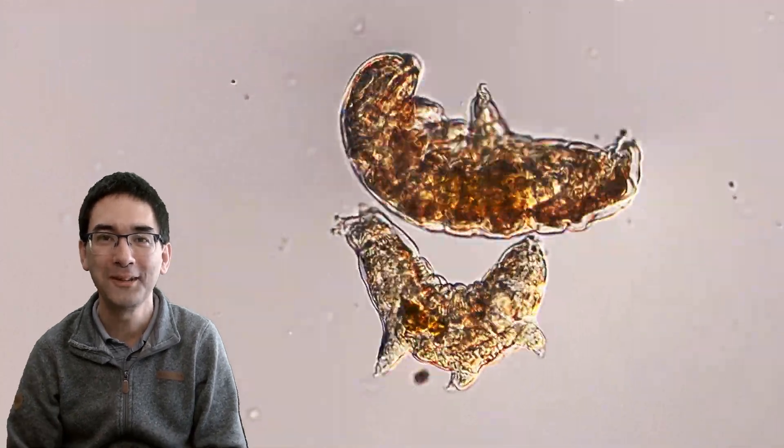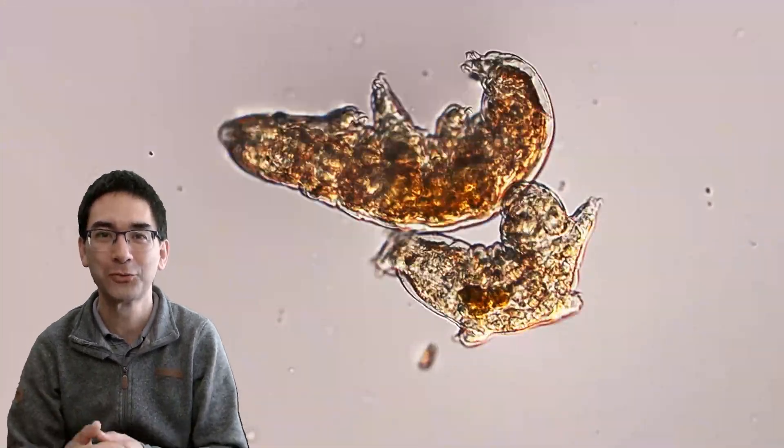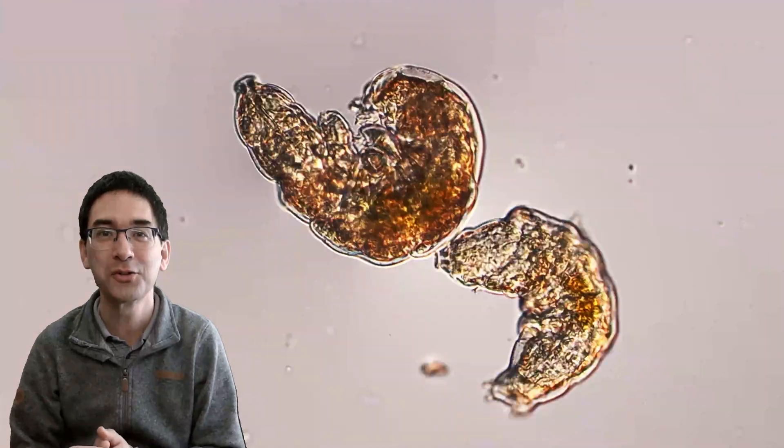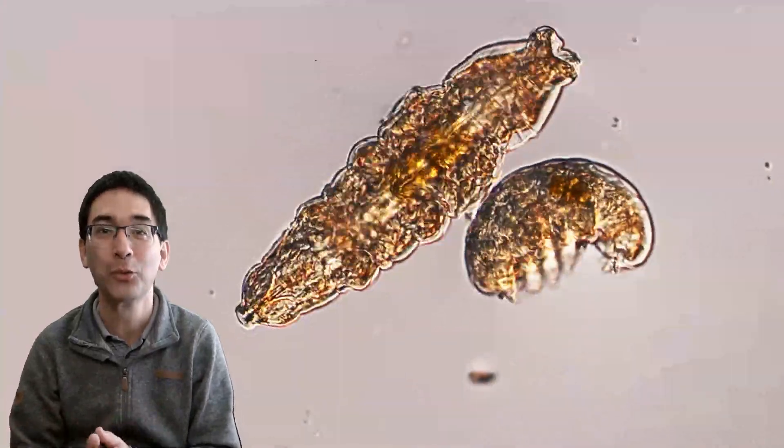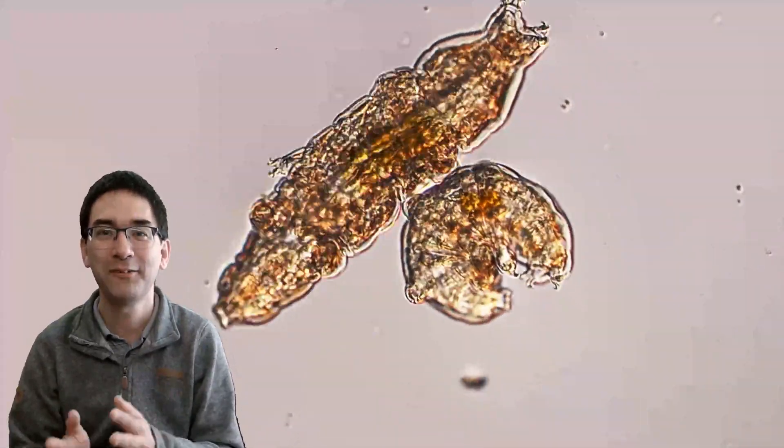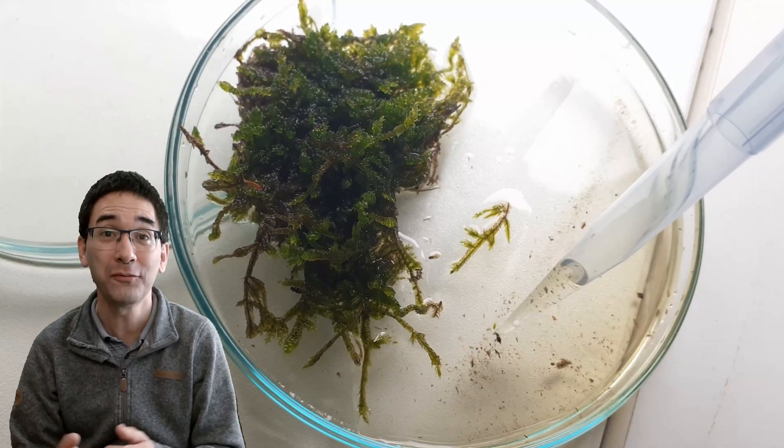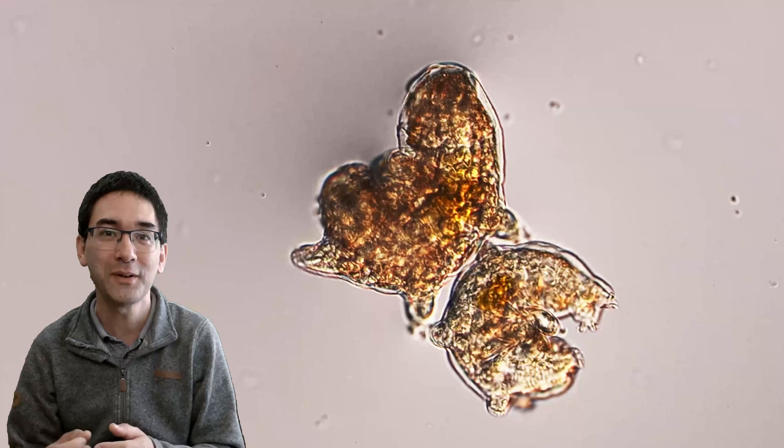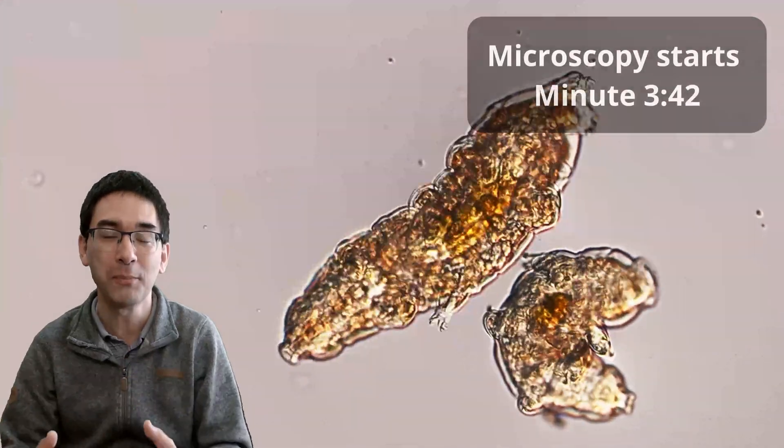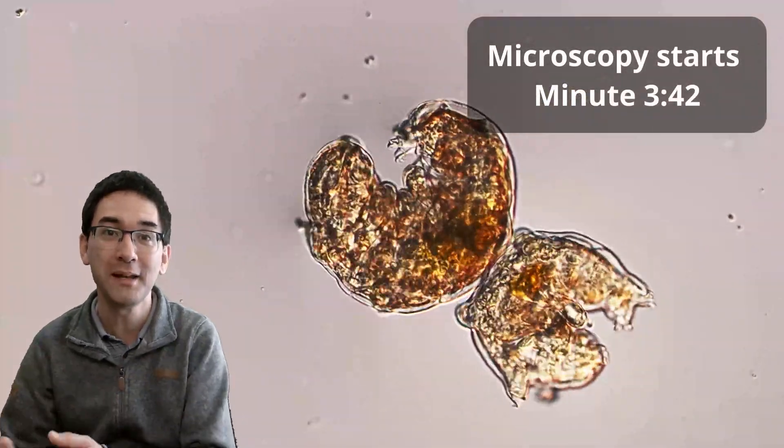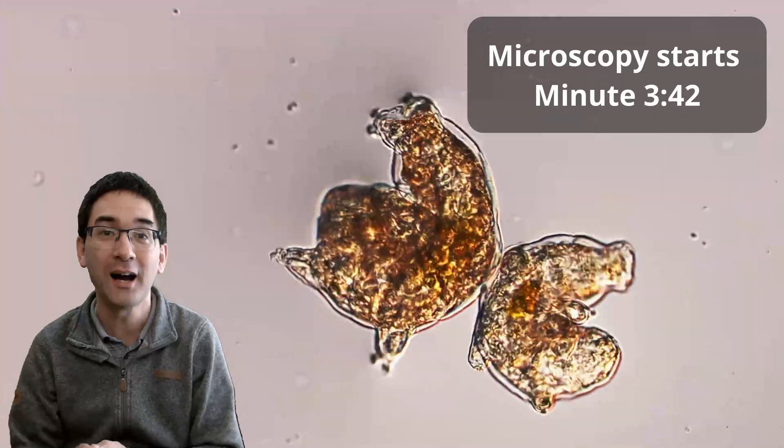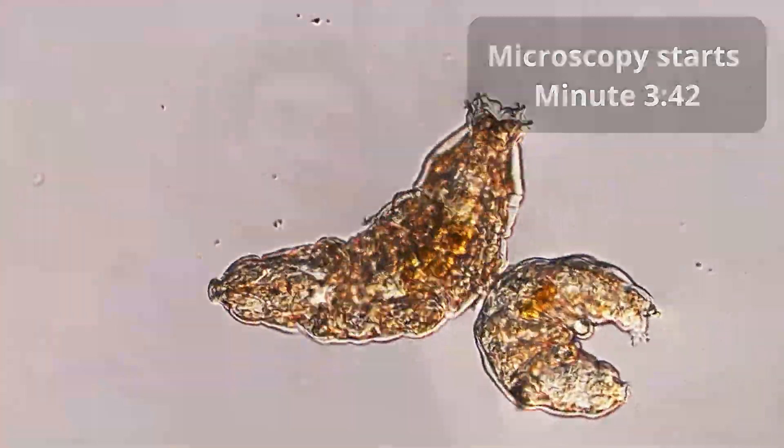Well today I'll go bear hunting. Not polar bears, not grizzly bears, but these are known as water bears, tardigrades, or moss piglets. And I found them in a sample of moss and today I'd like to show you how I found them and where I found them.